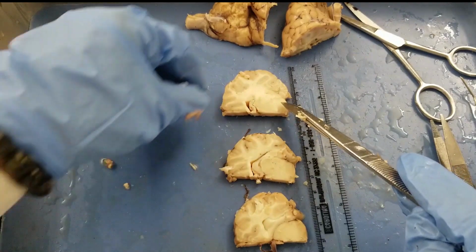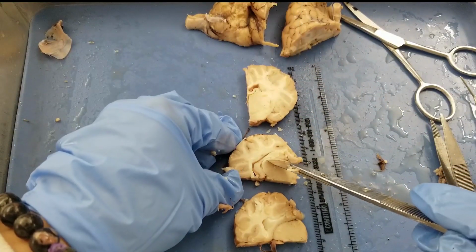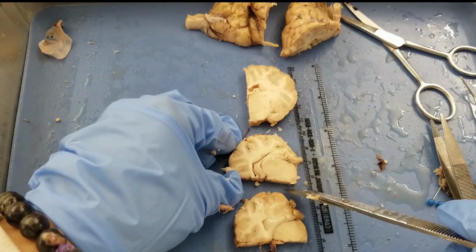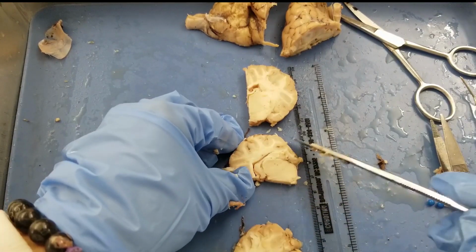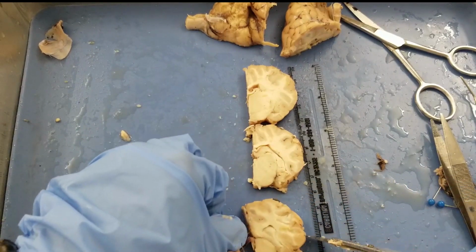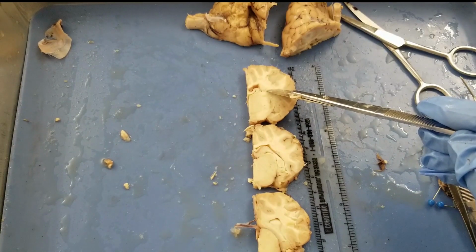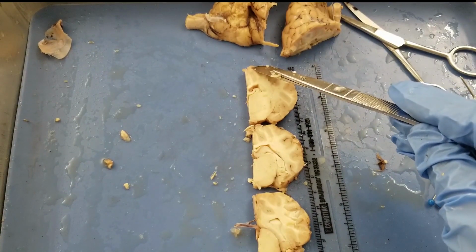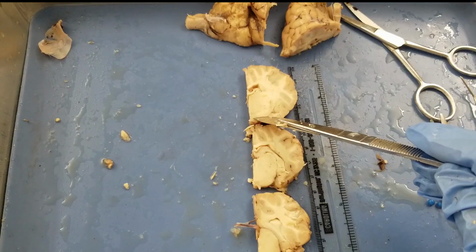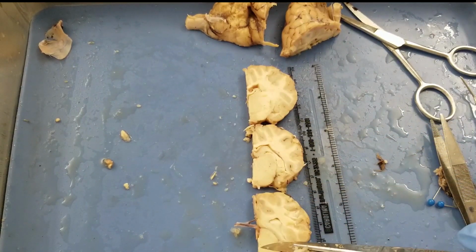So we need to place the ventral side closer to you, and this is the ventral side too, right? See, there is a big, very uniform structure, and that's the ventral side. And see, there's a texture. That's a cortex. That's the dorsal side. Okay, so this is the most anterior slice, and this is the dorsal side of the slice. This is the ventral side. Same thing, dorsal side, ventral side, and this is the last slice.